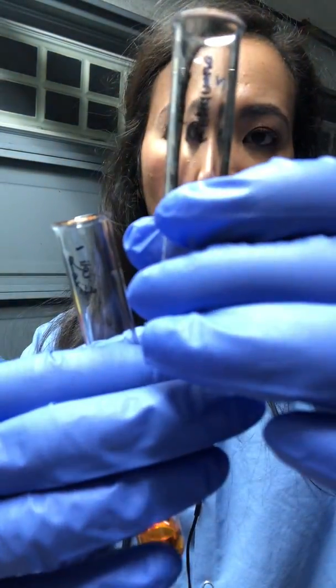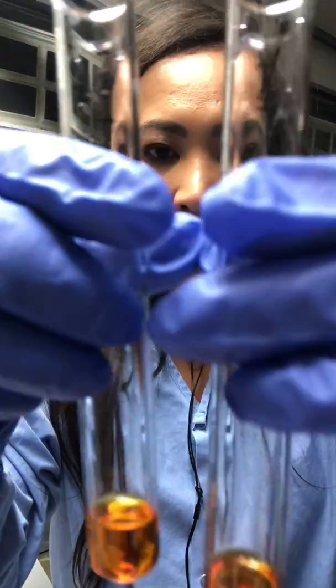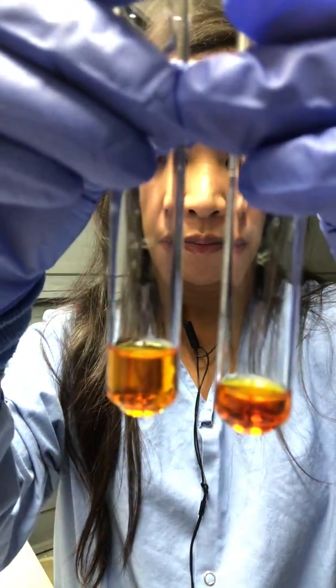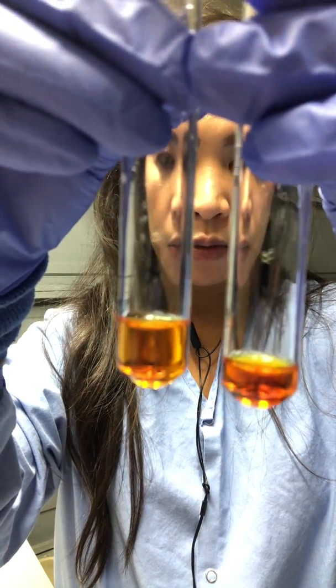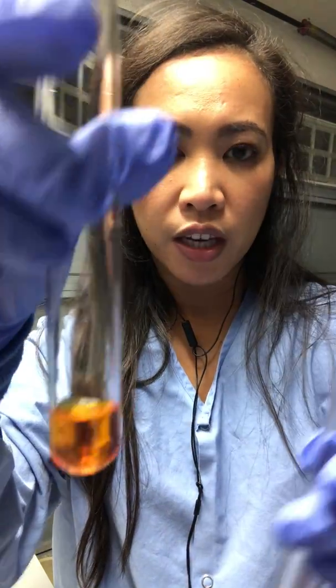As you notice, this is the S. epidermidis, and then this is the E. coli. The main difference is the color, maybe, but very similar. This one is a lot brighter red, and this one has sort of a red tinge to it with a yellow, but it still turned positive according to the guide on the lab report. It still tested red.